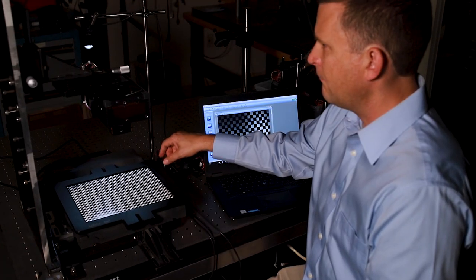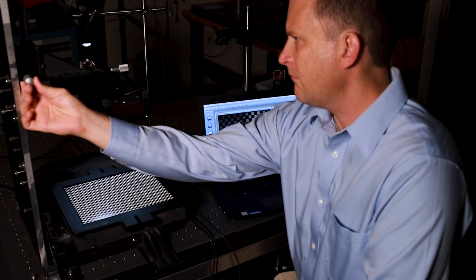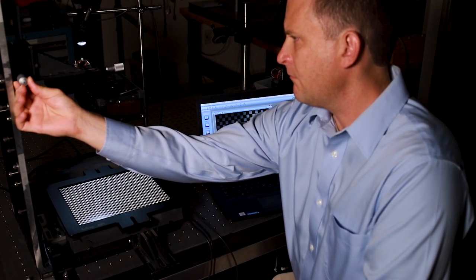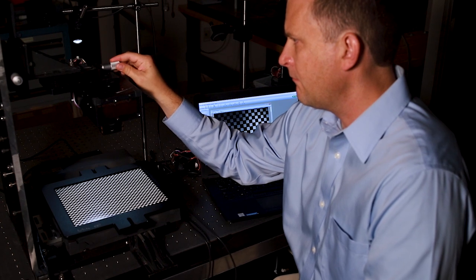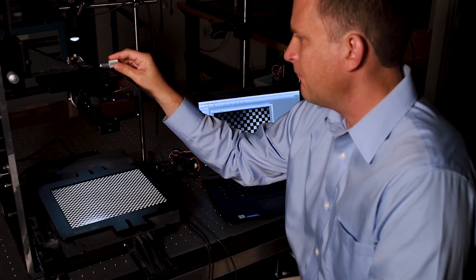Are there any other unwanted image artifacts that have appeared regardless of the source? We had to try all of the spectral channels with a whole series of different stains to make sure nothing untoward was happening. As a scientist, the integrity of the data is extremely important to me. I design instruments as if I'm going to be the one using them. Bio-Rad as a company has been very adamant about the quality of data forever in its imaging instruments. We have patents on image correction for blot and gel sampling from back last century, and more patents this century regarding how to calibrate and improve the quality of imaging.